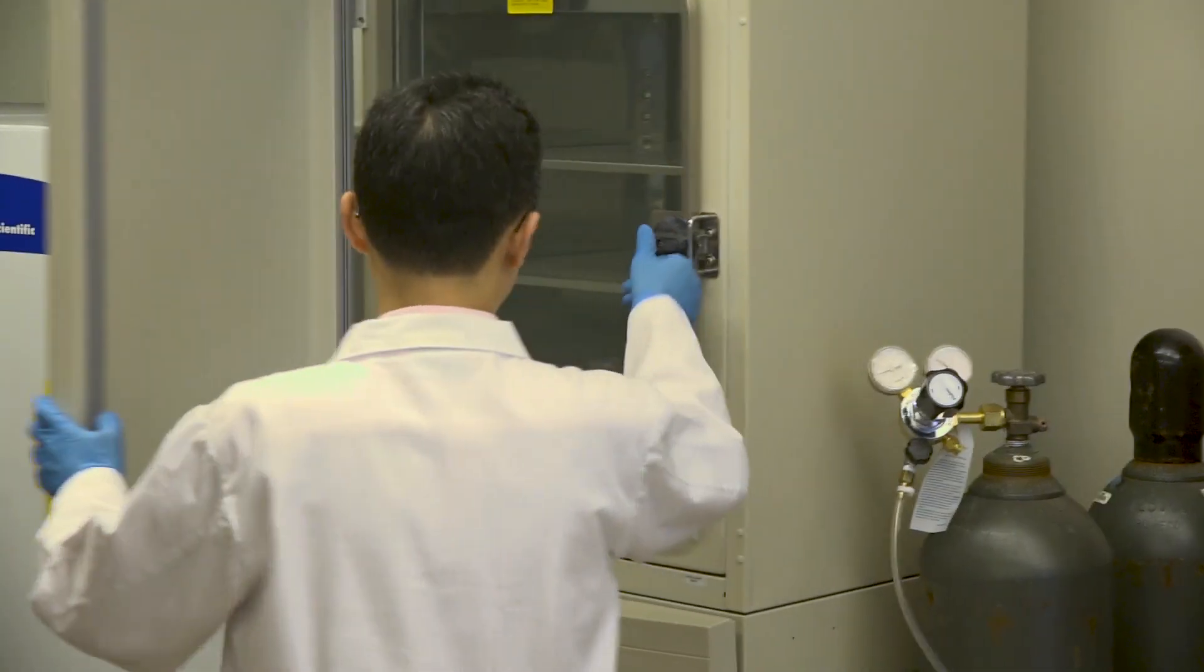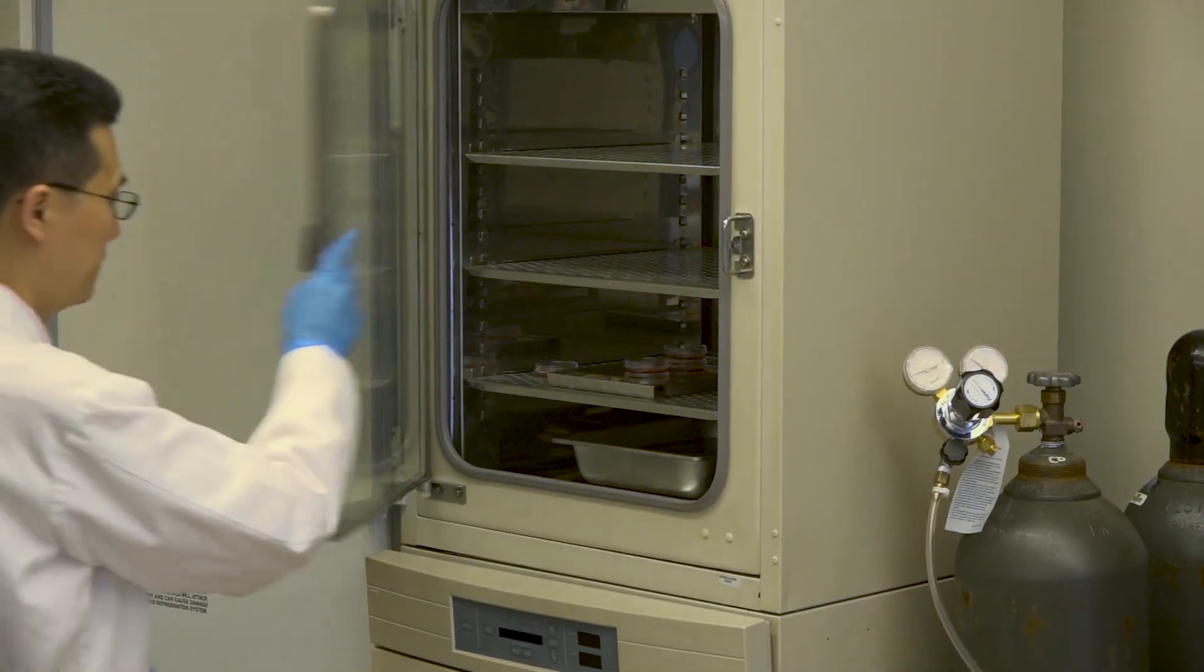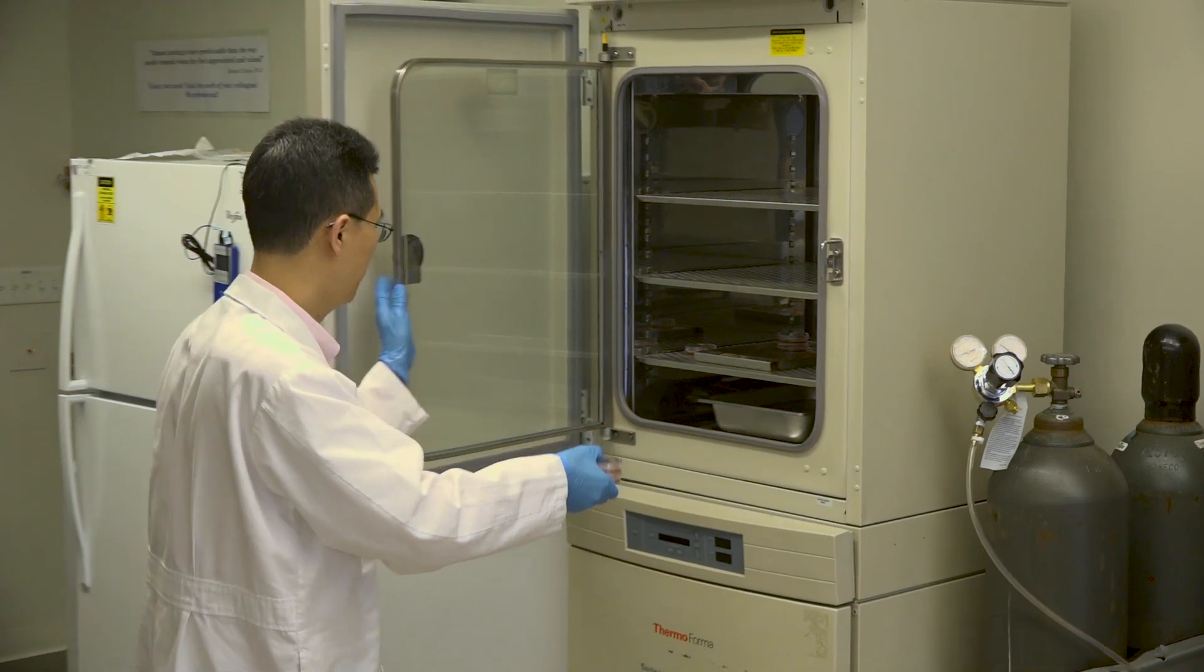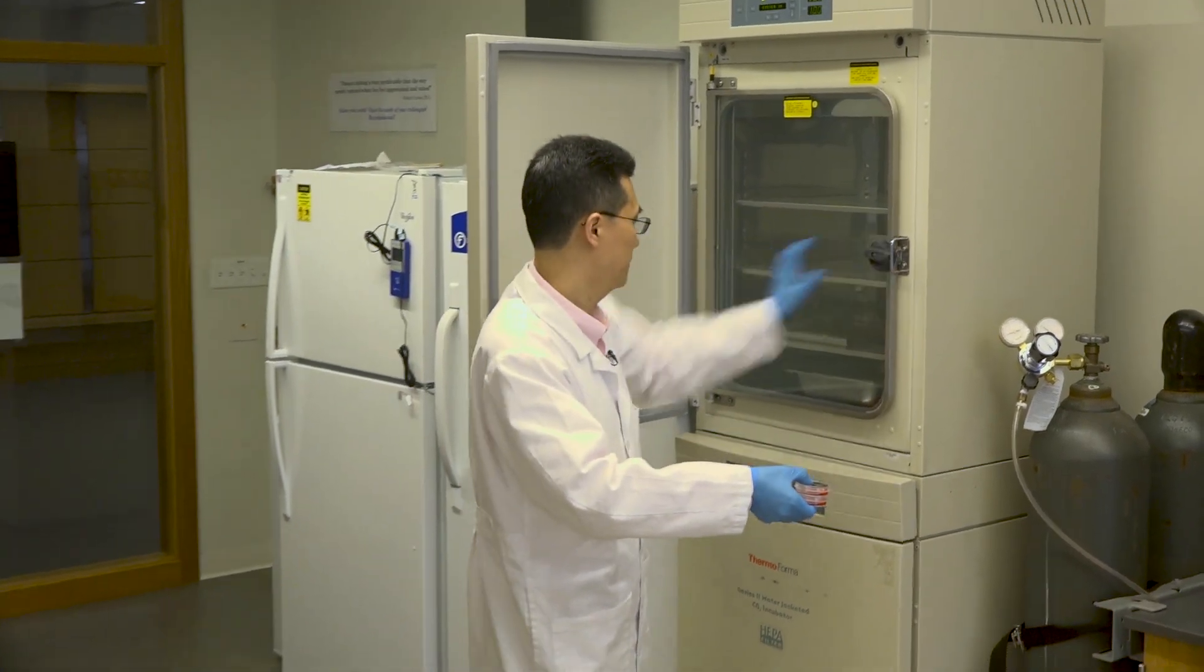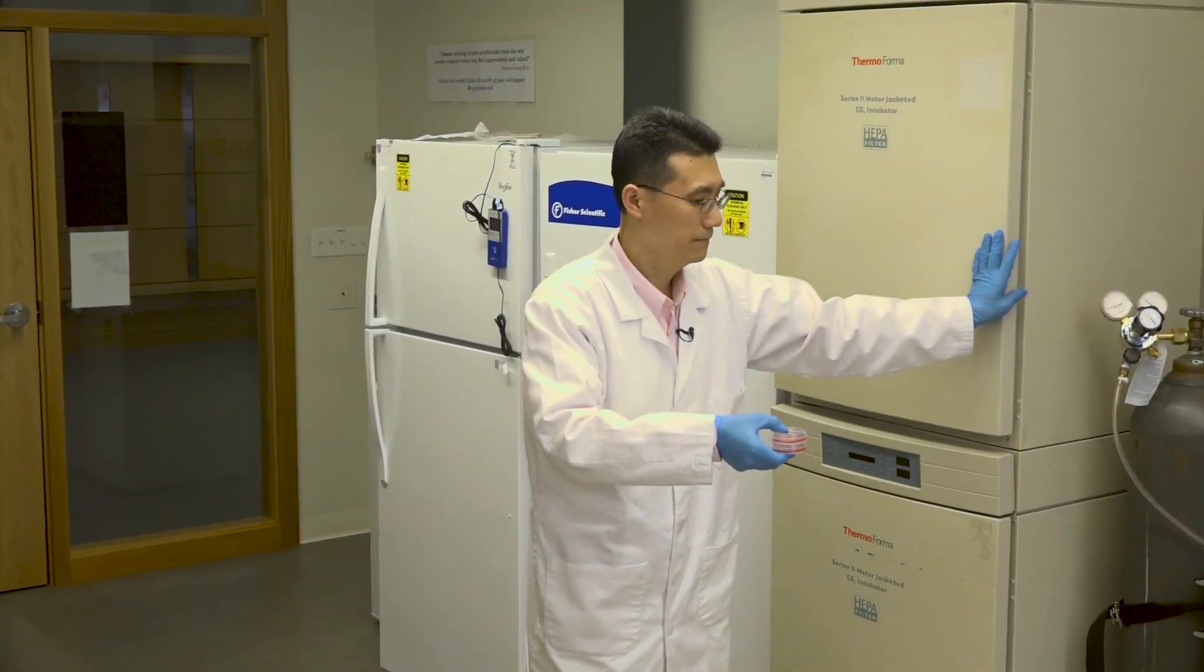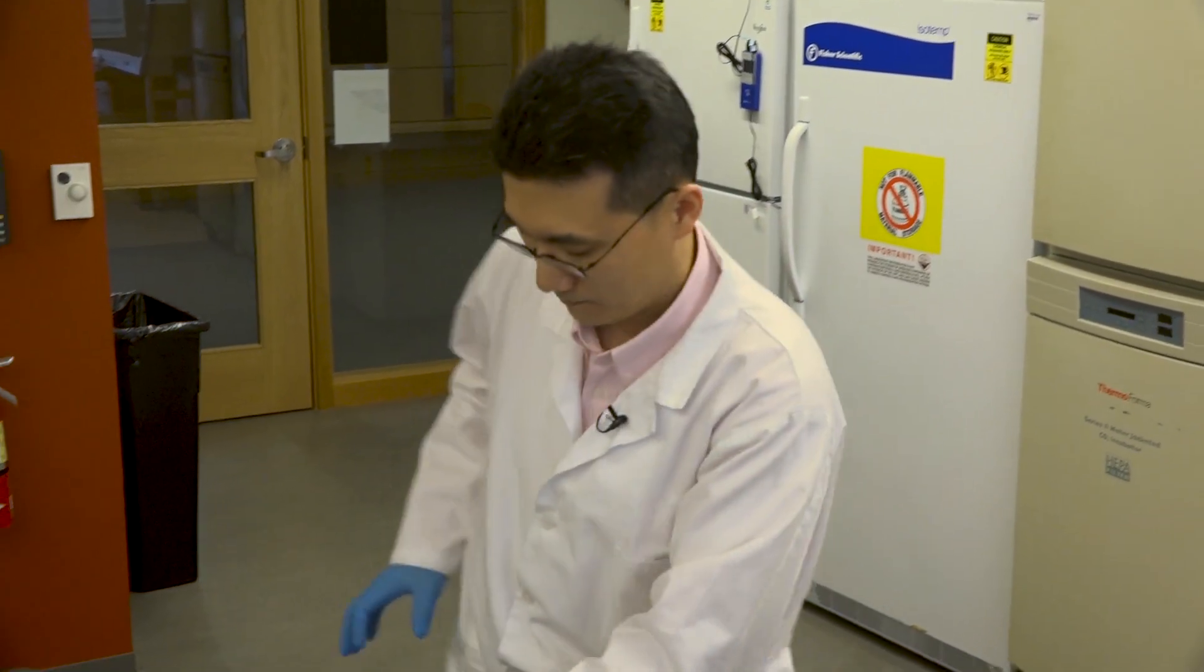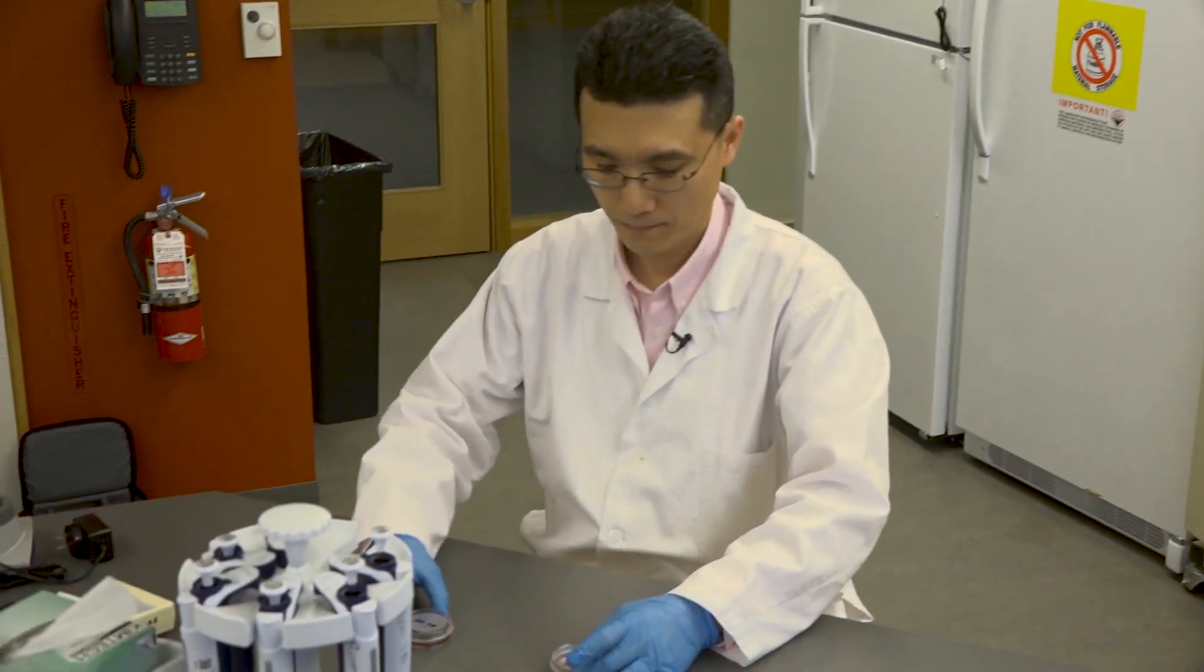After the incubation is complete, take out your dishes from the incubator and return to your bench. For simplicity, the rest of the video will only demonstrate how to process one sample. But in the lab, you will work with your partners to process both samples.